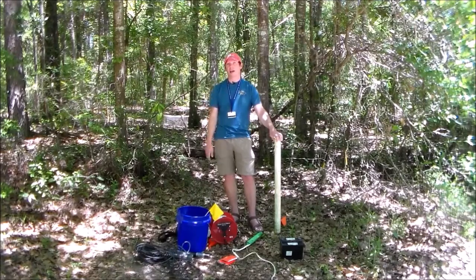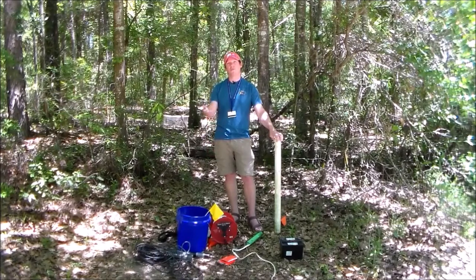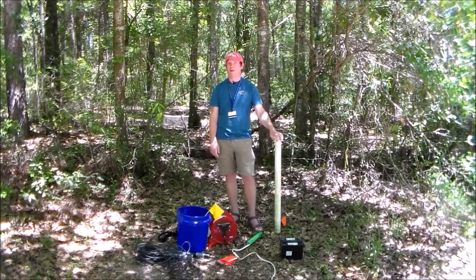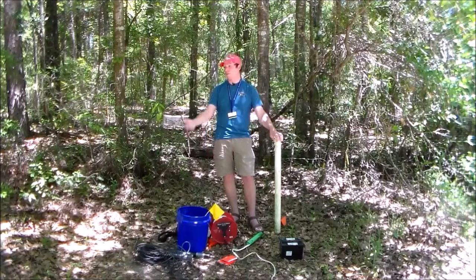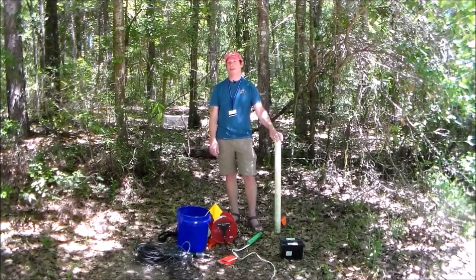So you guys are now working with contaminants, and I'll go into more detail about it in probably another video, but you're going to be working in groups for this lab, and each group has been assigned a contaminant. And so you guys will have to figure out how to remove that contaminant from the aquifer. So it could be an organic compound like benzene.